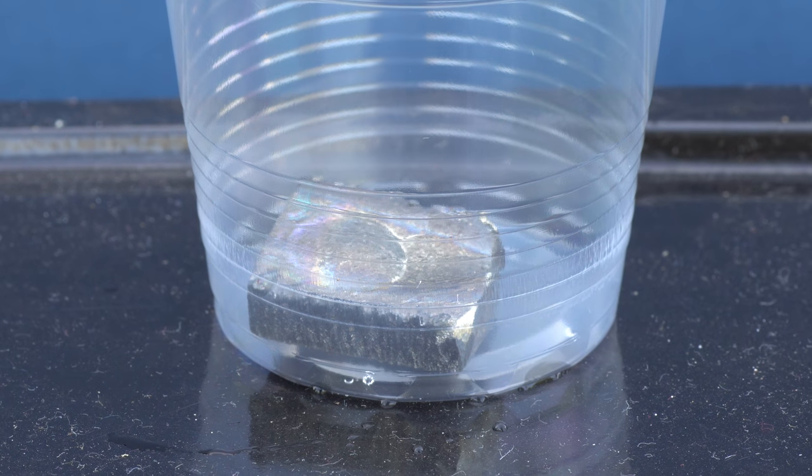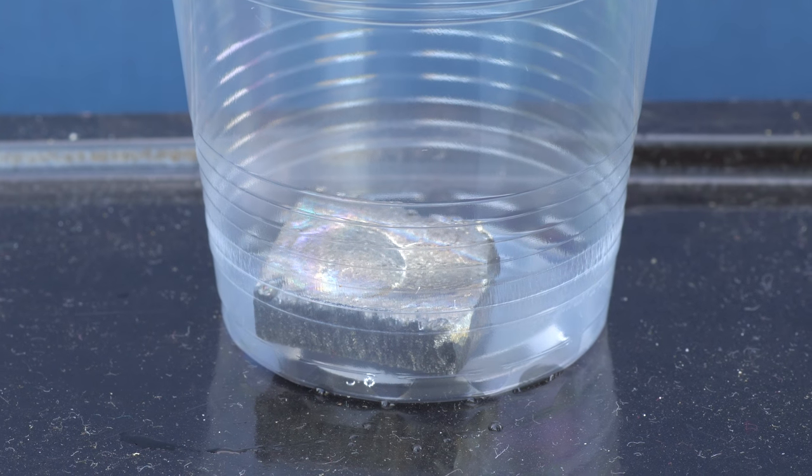Let's take another less active metal, hafnium, which in chemical activity is similar to glass due to the strong oxide film. As we can see, it dissolves in the hydrofluoric acid even better than titanium. Again, due to the fact that being in this acid, the oxide film immediately dissolves from the surface of hafnium, and so the unprotected metal begins to actively dissolve.